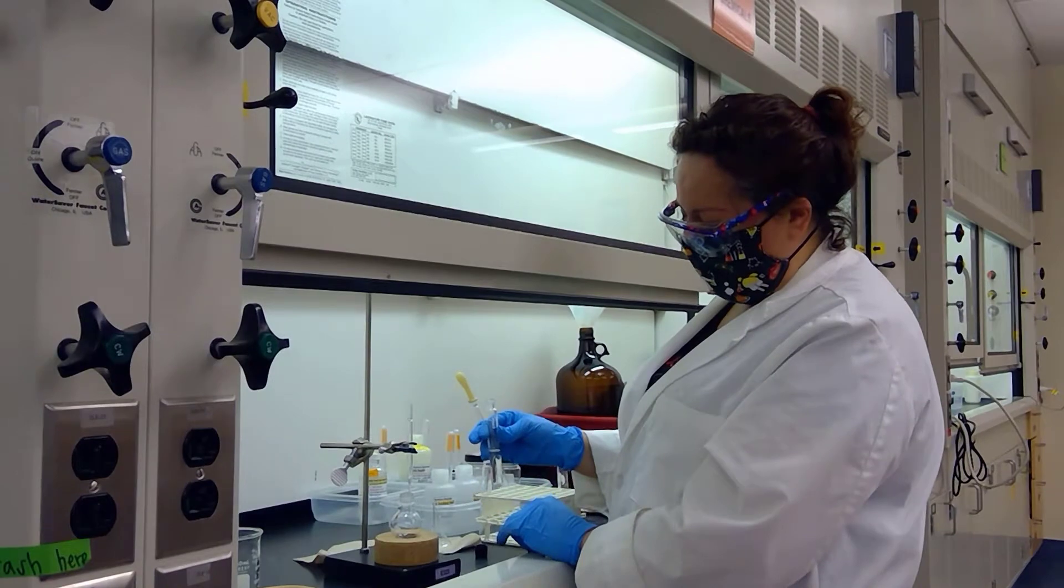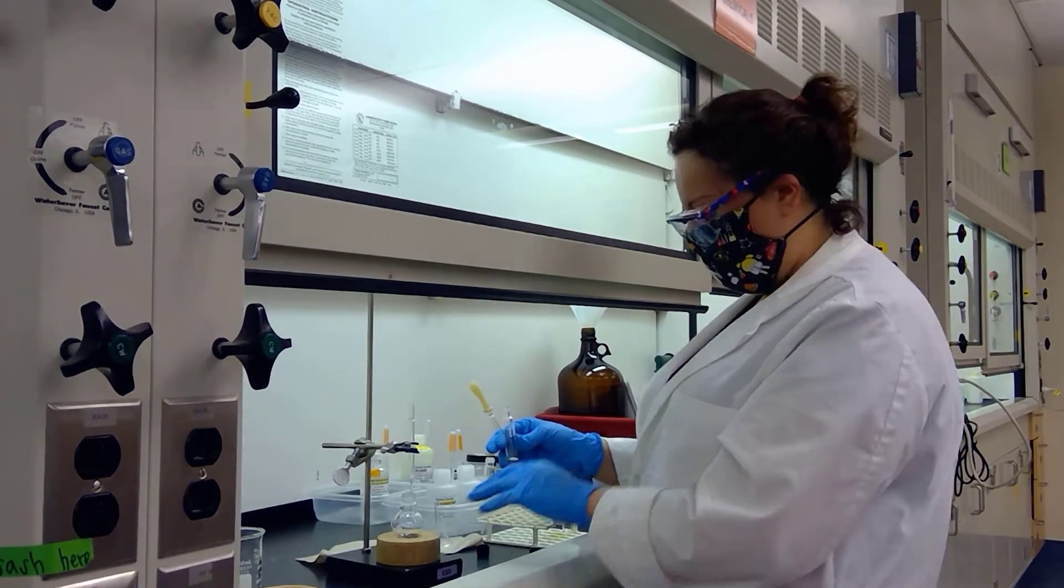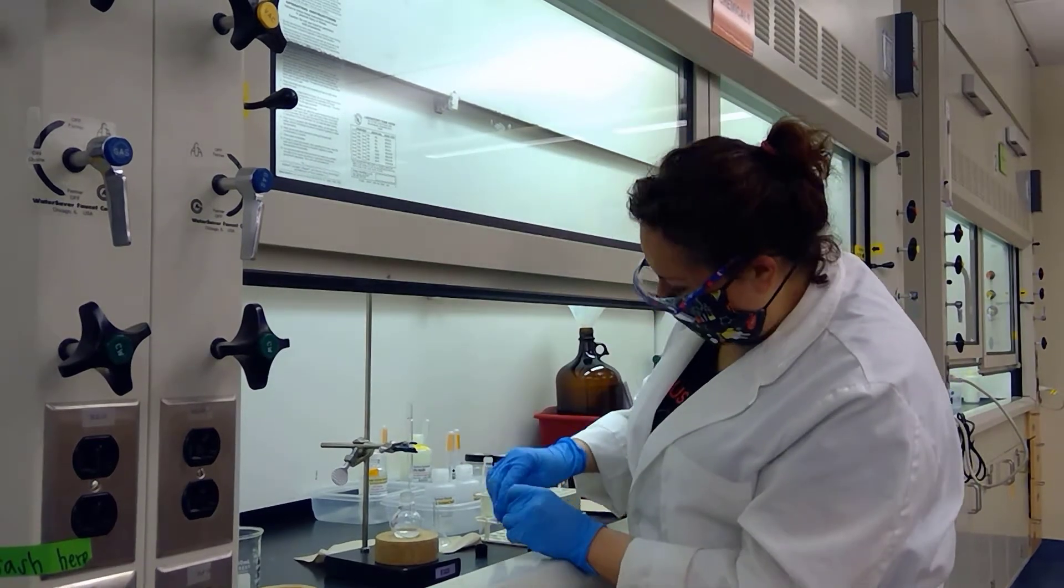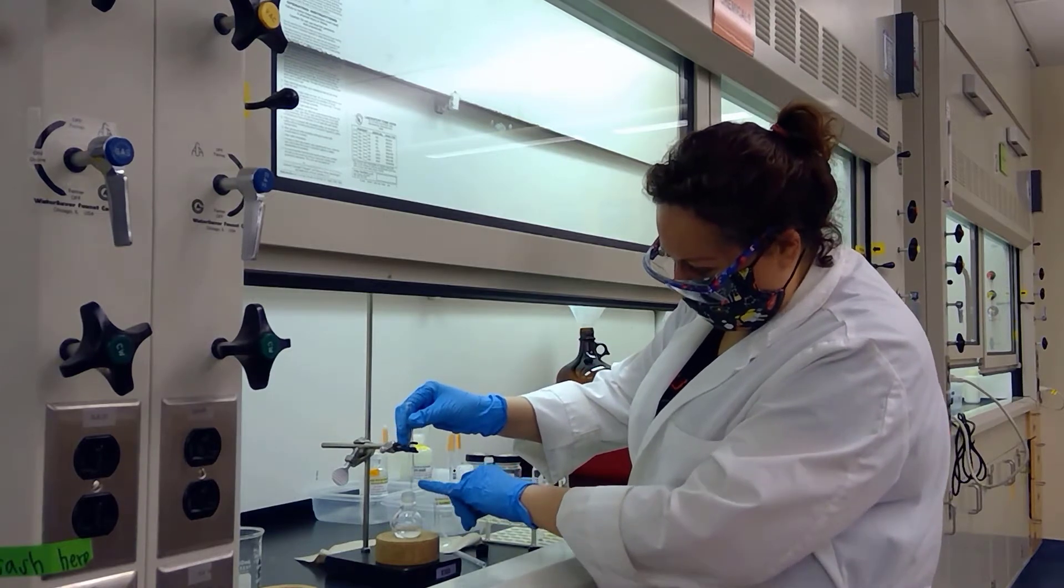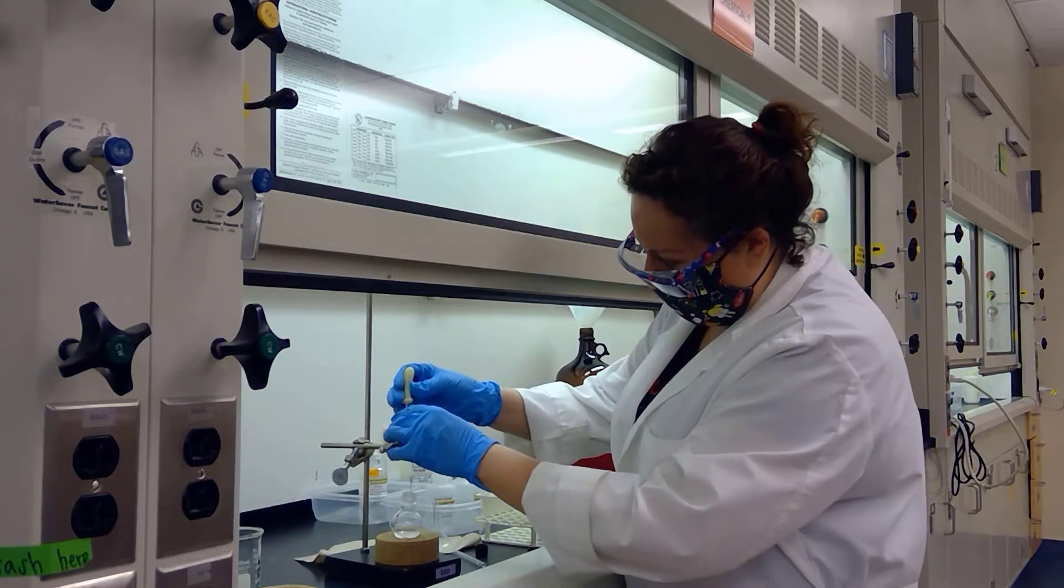We are going directly into a 25 milliliter round-bottom flask. Now that I've transferred all of the liquid, to ensure I maximize the amount of liquid captured, you'll notice there's always a little bit that gets stuck beyond the cotton portion.